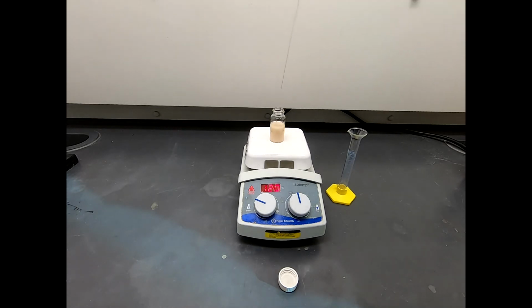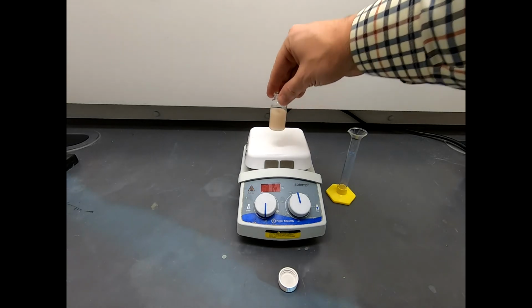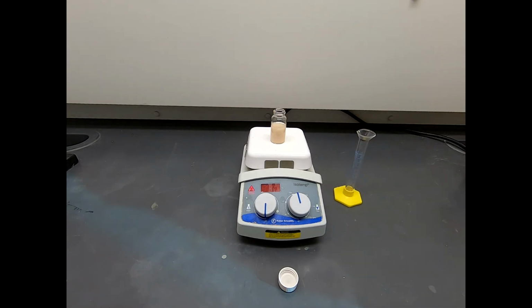There we go. Now, I was going to let this sit on the hot plate, so that as the hot plate cools, let's turn that off, this thing would slowly cool, and in case it oiled out, it would slowly solidify. But as you can see, it's formed solid great. Spinning around, we got lots of solid. That looks really good. We know there's no starting material, so I'm just going to let this cool on the hot plate with stirring, and maybe in 30 minutes it'll be close to room temperature, and then we can go ahead and do a filtration to isolate our crude product.